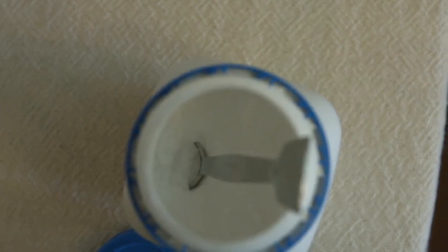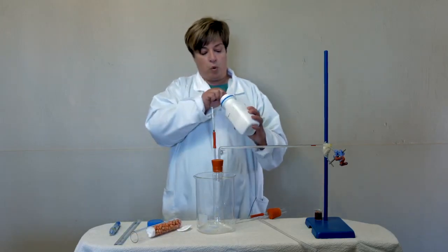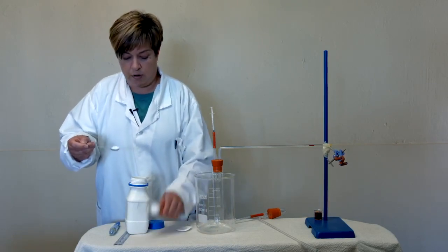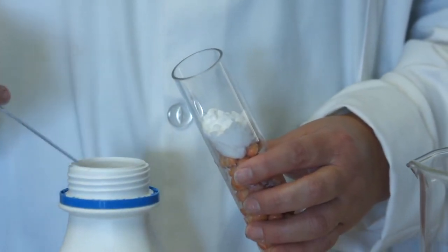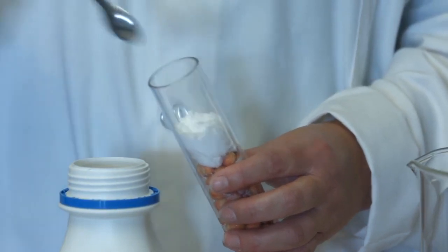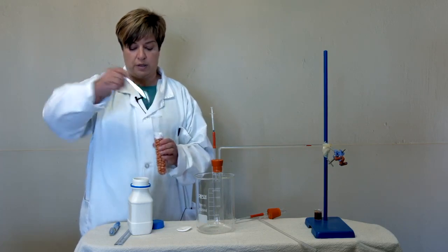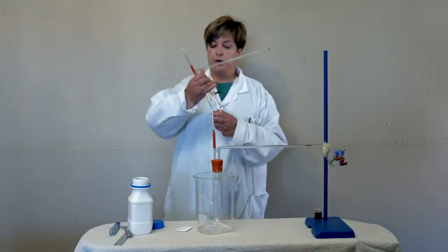Now, what is the function of the soda lime? The function of the soda lime is to absorb all the carbon dioxide that is being produced. We're going to use a spoon, and then we are going to layer it on top. Why do we want it to absorb all that carbon dioxide? Because during respiration, for every oxygen that is being used, a carbon dioxide has to be produced with some water vapor. Now we are going to set up our experiment.